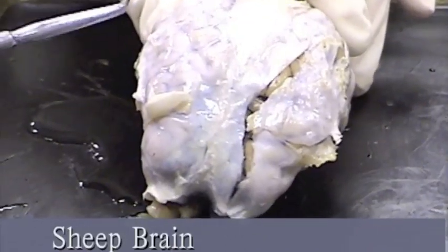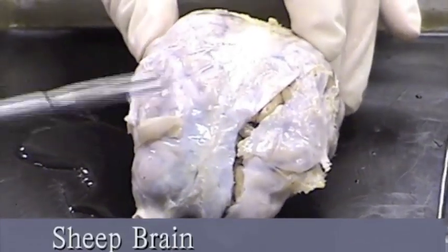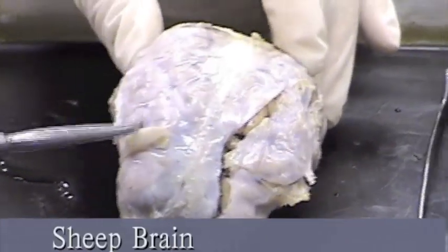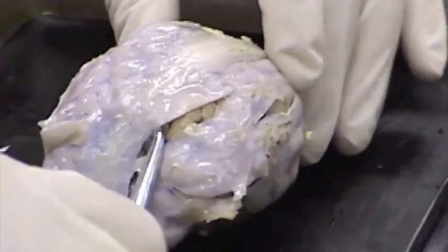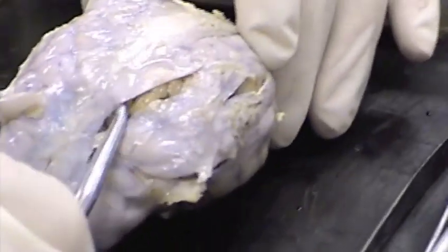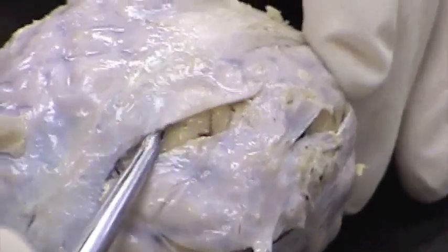Here we have the sheep brain covered by the dura mater. I am putting the probe under the dura mater in the subdural space.